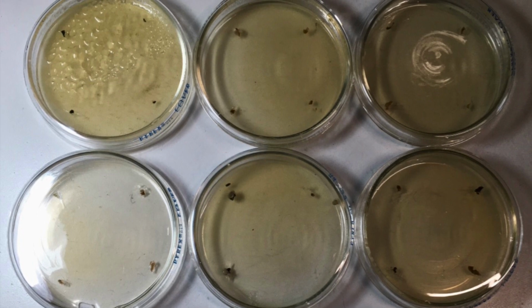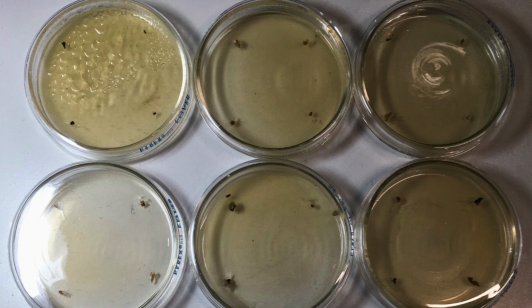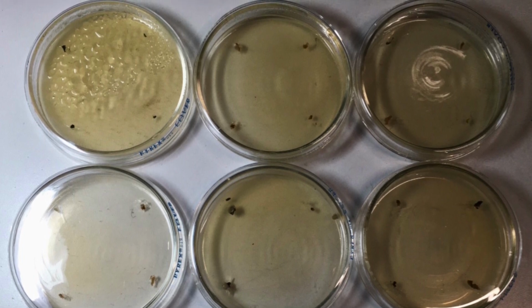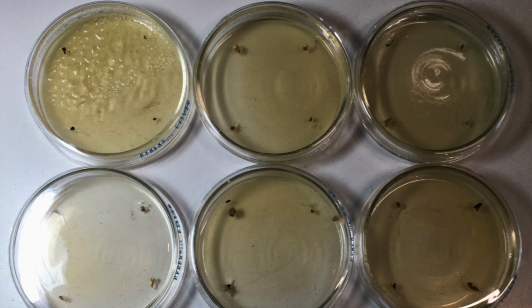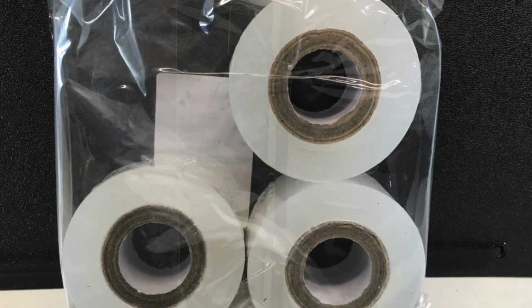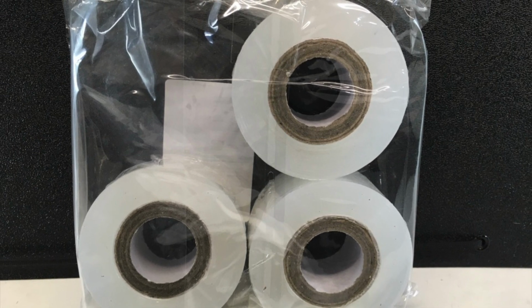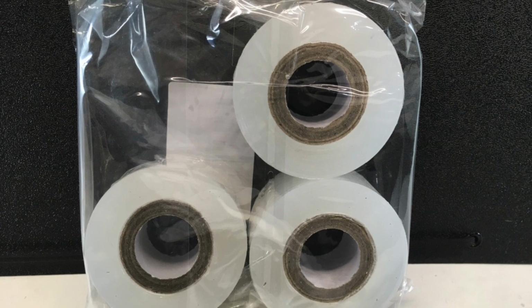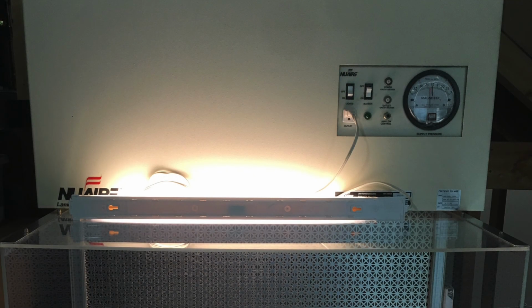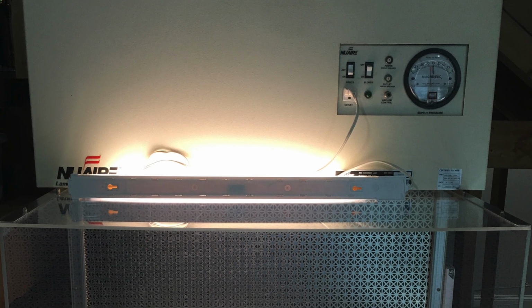I also use a graduated cylinder to measure out the water, but that was also used previously and had been successful. I use grafting tape since November of 23, but that doesn't touch the agar itself. I also started using a flow hood in October of 23.